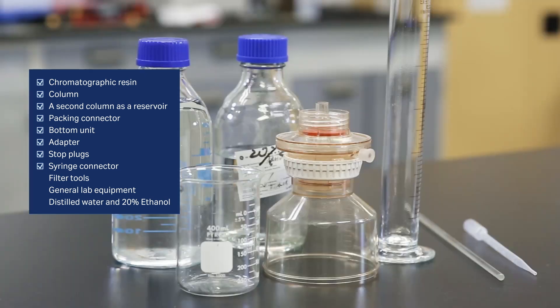column stop plugs, a syringe connector, filter tools, and general lab equipment. You should also have distilled water and 20% ethanol.